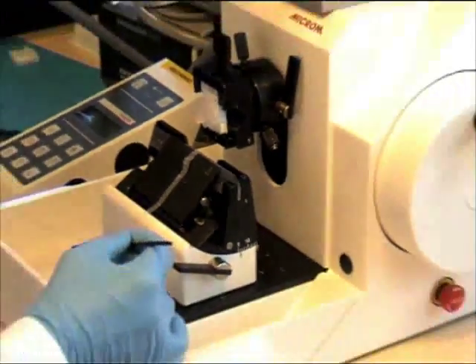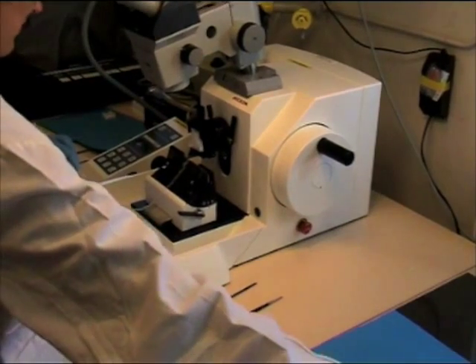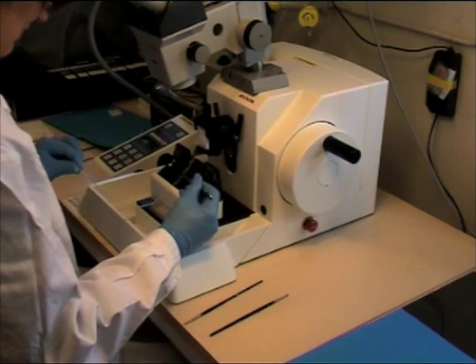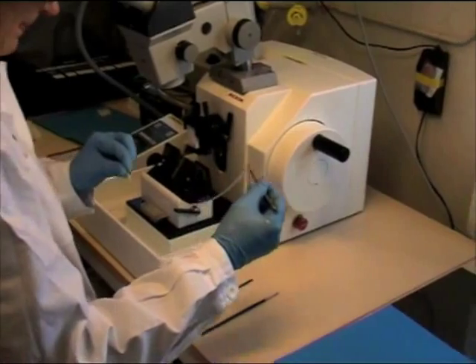Cut off a ribbon and move it to paper. At this point, it is possible to inspect the individual sections under a stereomicroscope to choose sections of interest. It will be easier to perform the inspection if the tissues are stained with eosin.